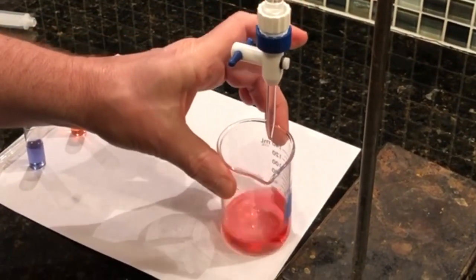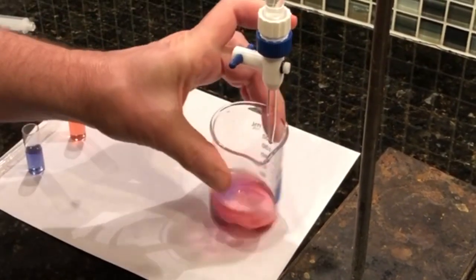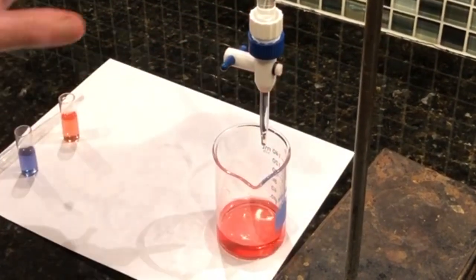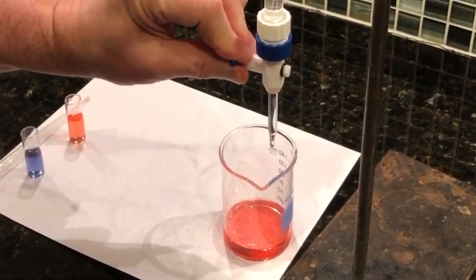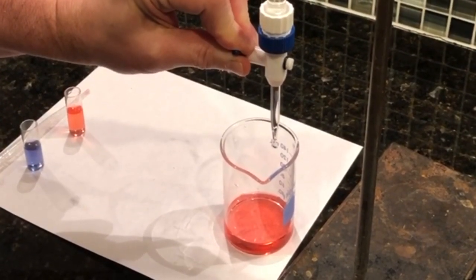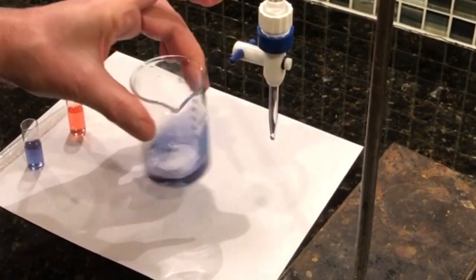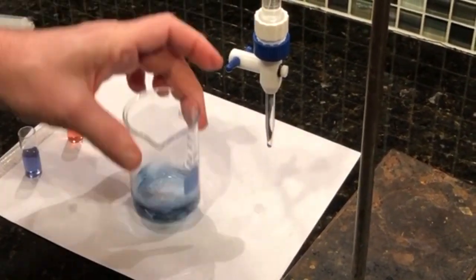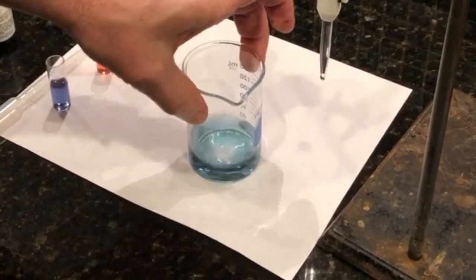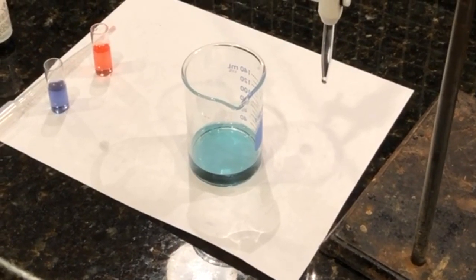There's less and less acid in there to make it go away as we get close. And ooh, that was just about it. So it shouldn't take but a drop at this point, because as we just saw, it really doesn't take much. So there you go. So that is the titrated amount.